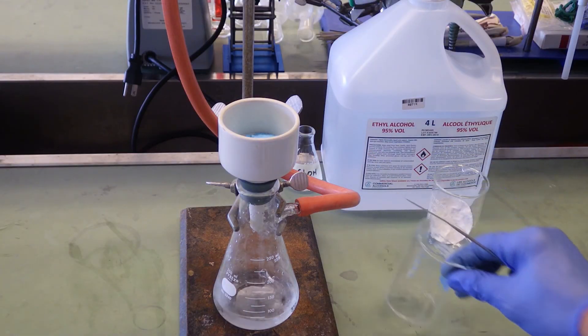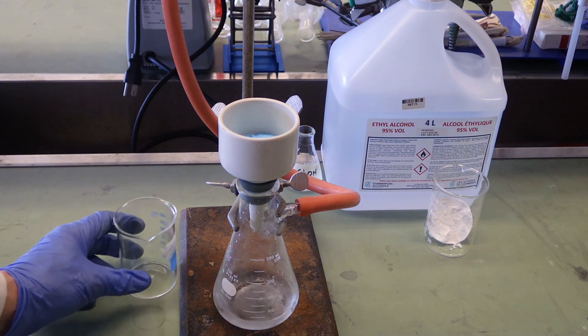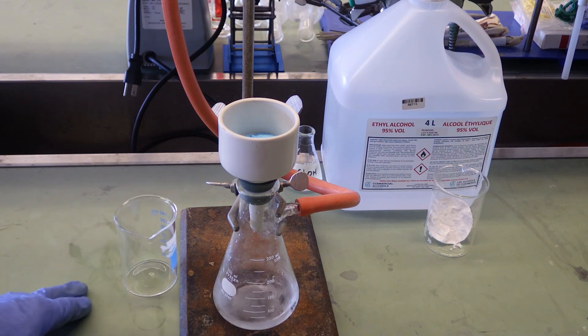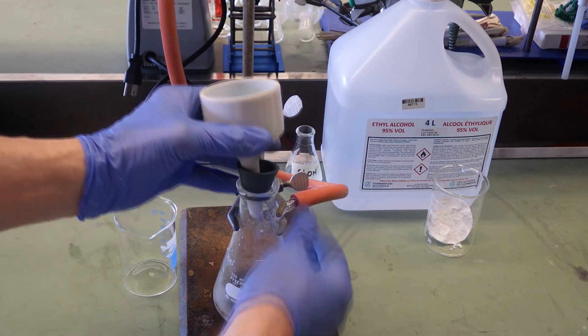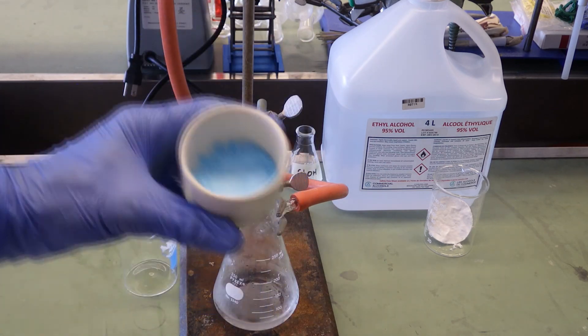We're going to quantitatively transfer that to our pre-weighed beaker and we'll let it air dry overnight before getting a final weighing. I'll speed this one up.